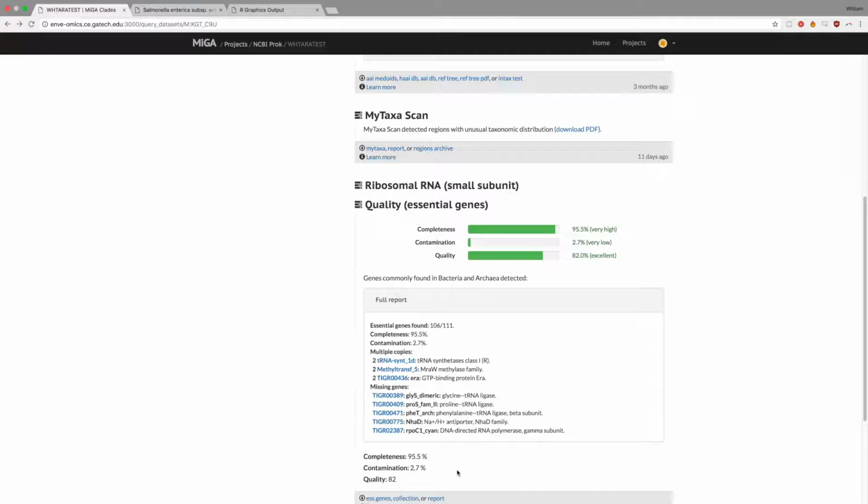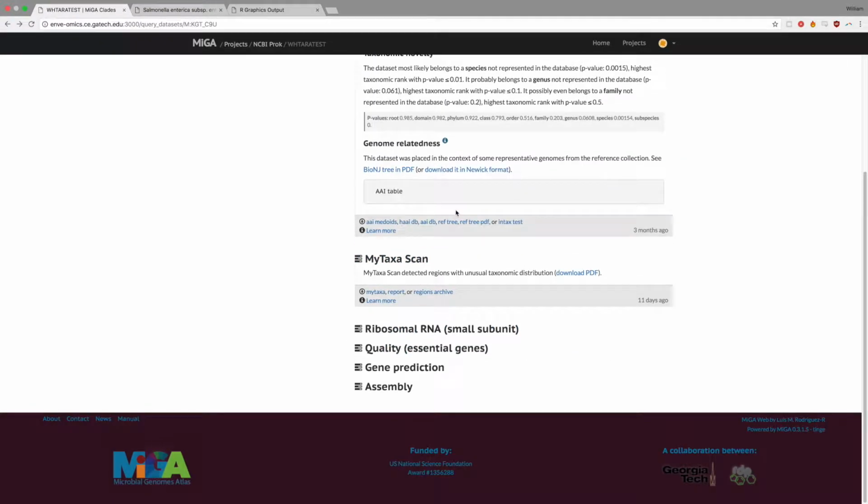It is important to note that this is a universal attempt at quality assessment. Further analysis via techniques such as single-cell amplified genomes can confirm if the multiple copies of traditional single-copy genes are real or the product of chimerism. This chimerism can also be explored further via the MyTaxa Scan tool.